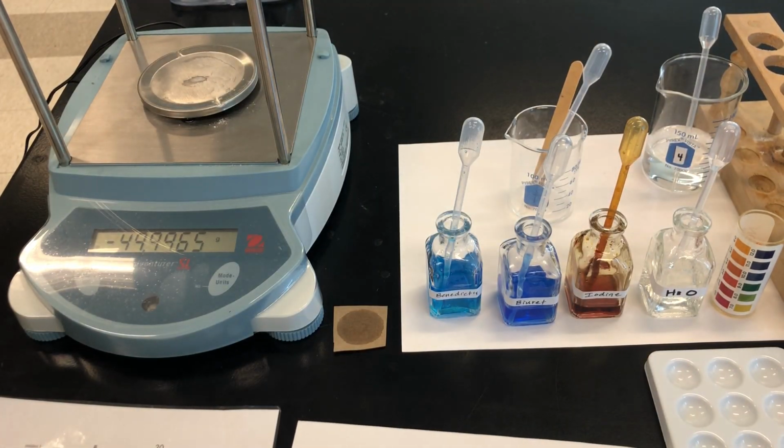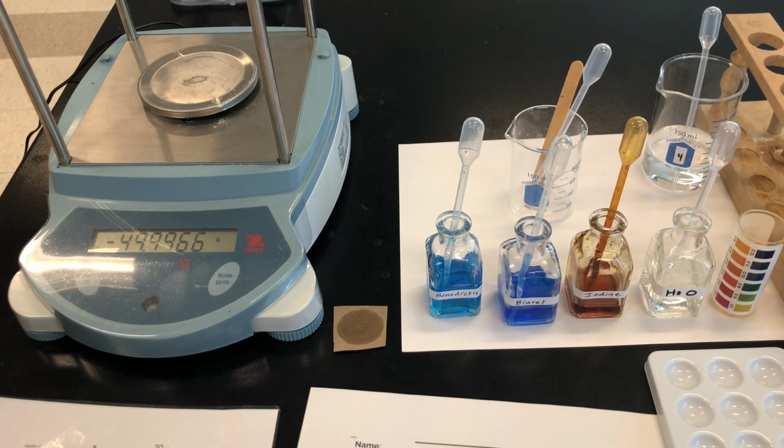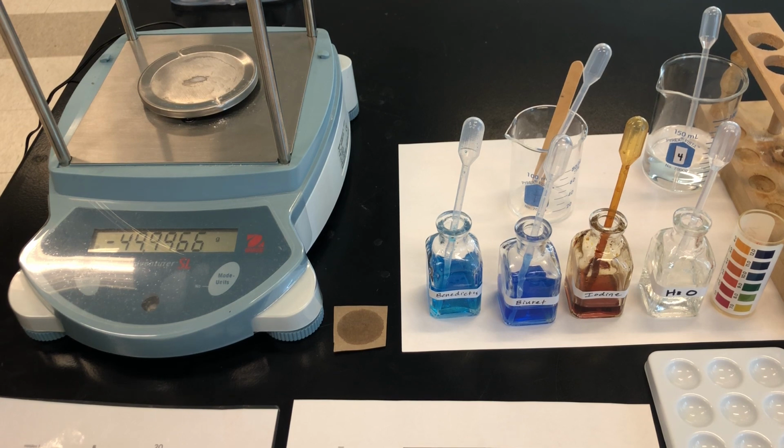Some of the liquids that we use in this lab are dangerous to get in your eyes, and they're also not great to get on your skin. So if you get something on your skin, just wash your hands or skin right away and let me know. Don't get things in your eyes. You have splash goggles that you should wear anytime you're handling liquids in this class. If you do get something in your eyes, let me know right away because I will need to send you to the nurse.